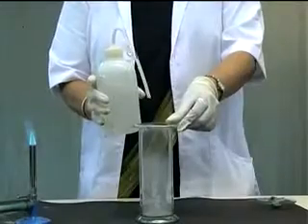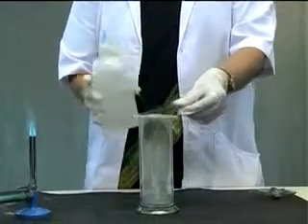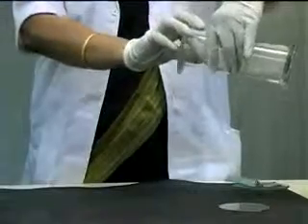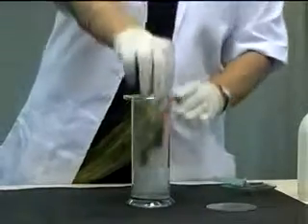It is then dissolved in a small quantity of water. The resulting solution is acidic and contains an acid known as sulfurous acid. It is tested for acidity with blue litmus paper. Blue litmus turns red as expected.